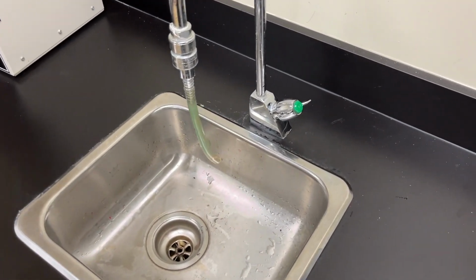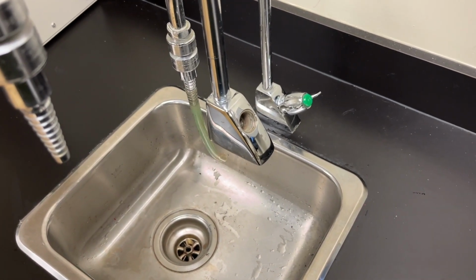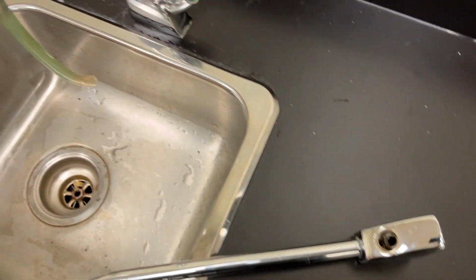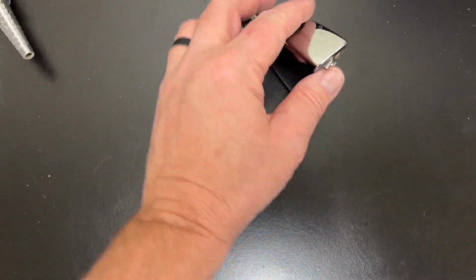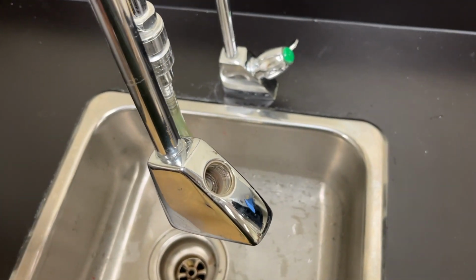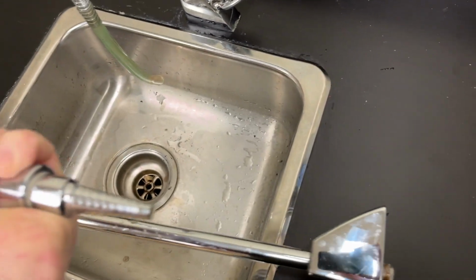And this is where it might get even more difficult, because I took another look at the faucet that I had, and while they're similar, they're not exactly the same. This is a T&S brand from Chicago Faucets, a very well-known commercial faucet manufacturer, and this isn't. If you look at the lines, these are slightly more rounded. They've taken after the design, but it's sharper corners. I'm going to say this is a knockoff, which is why it has a different cartridge in there, and which makes it even less likely that I can find replacement parts for the cartridge that's in there.